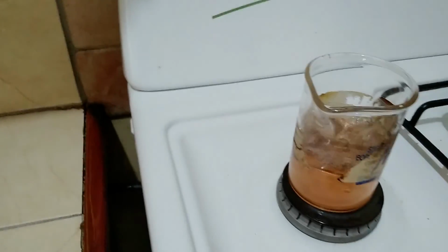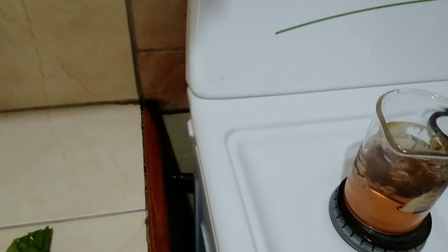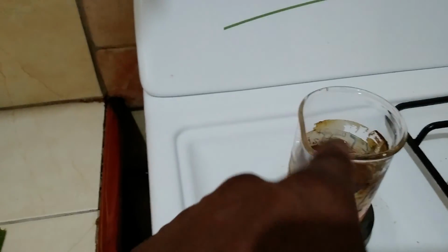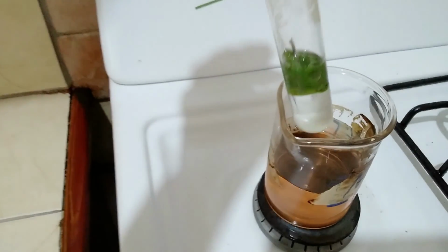All right, that's the color of the alcohol we're using. You have to watch this video because I'm going to be flashing the correct name for some stuff at the top. And here we have the open flames. We're going to turn it off. We're going to place the leaf in the boiling tube with the alcohol. Look out for the name that we're going to be using. And then we're going to be placing this boiling tube with the leaf into this water bath. Now it's a hot water bath. This is not hot water that you would want to have a bath in. All right, so we'll put it in there.